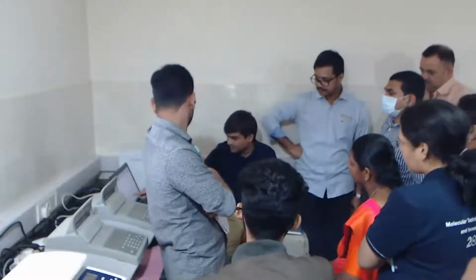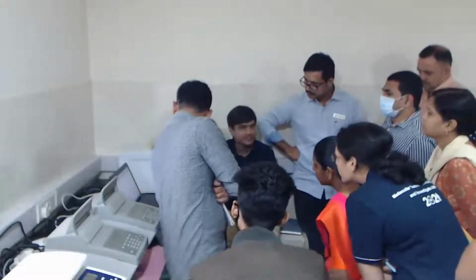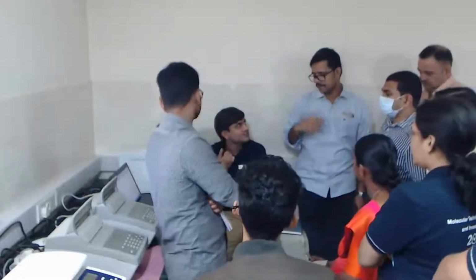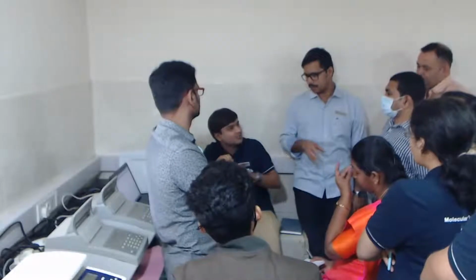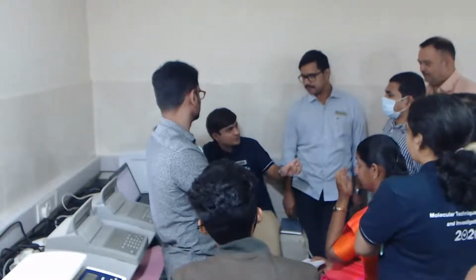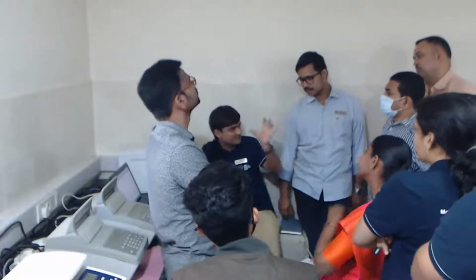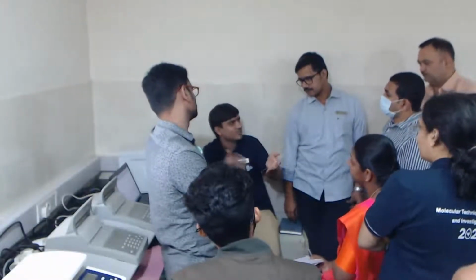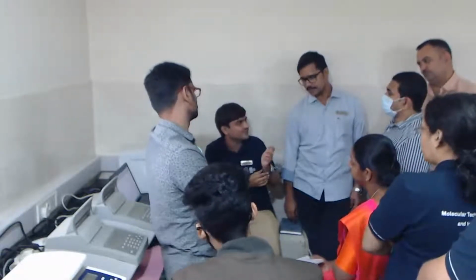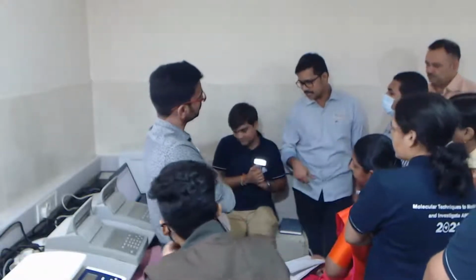Over here it will say the average size is 329. When the primers are given by the company, they will tell you the minimum size, and your entire design is shared with you: what the target was, the name of that target, and the sequence of that target. If you have the sequence, you can very well know the size and everything. Based on that, we are choosing the region.